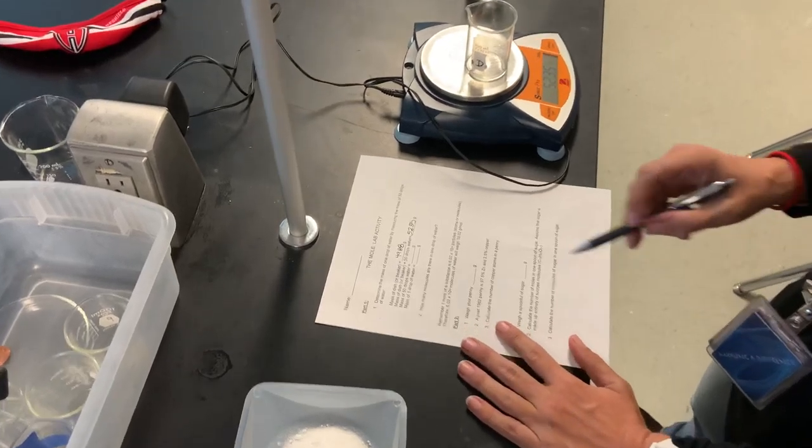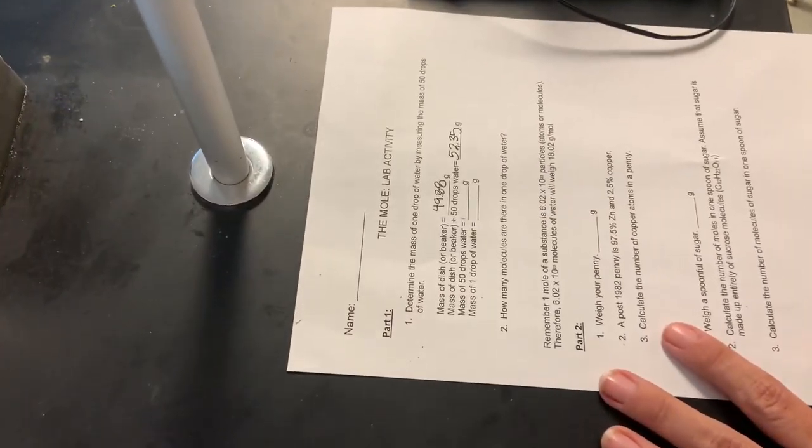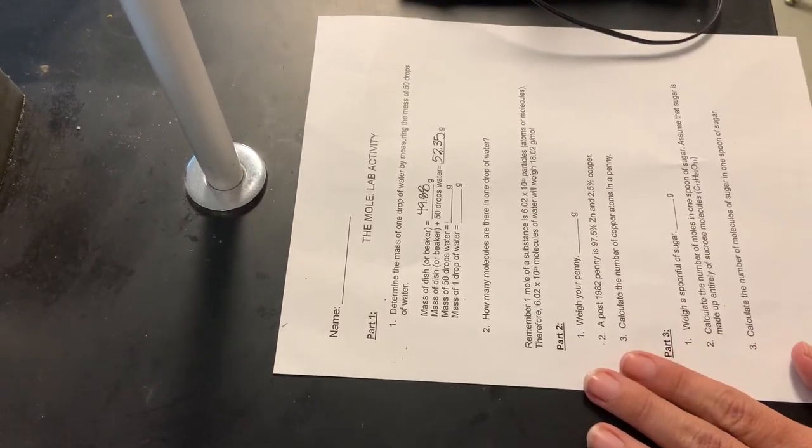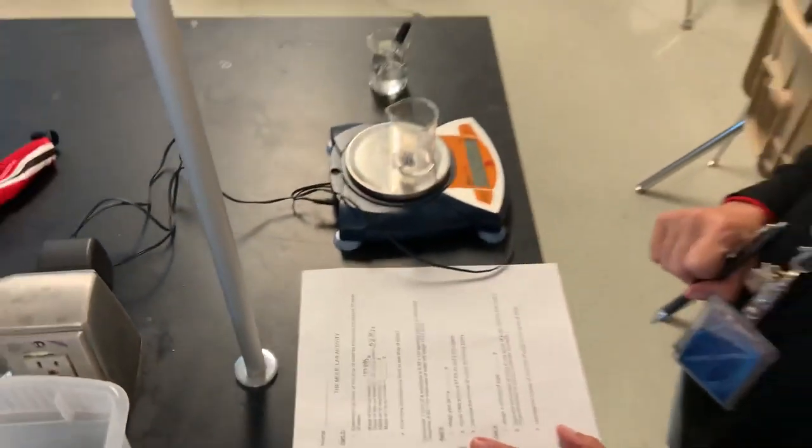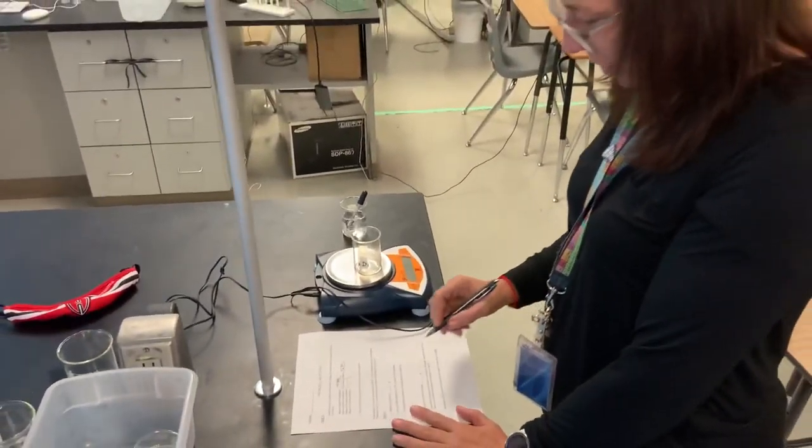The mass of 50 drops of water I'm going to leave for you to figure out, and the mass of one drop of water I'm also going to leave for you to figure out. I'm going to give you a little hint.